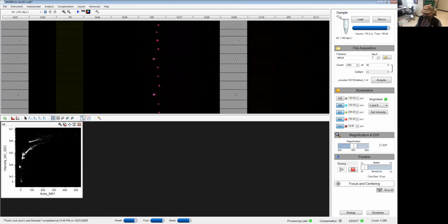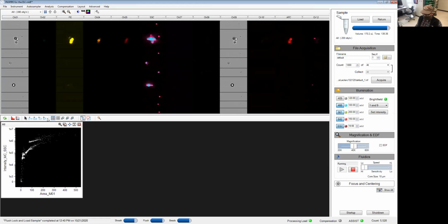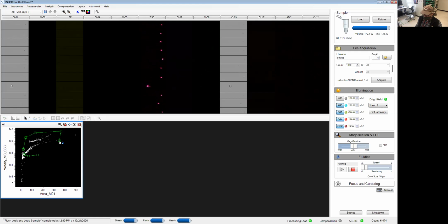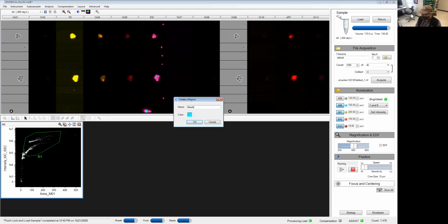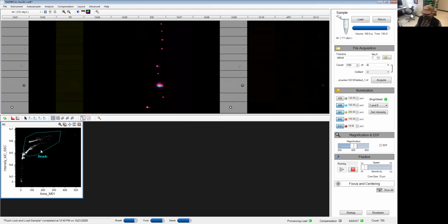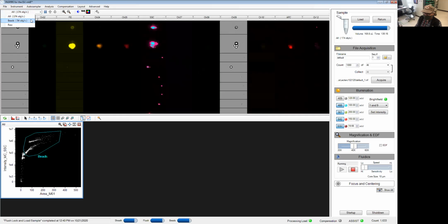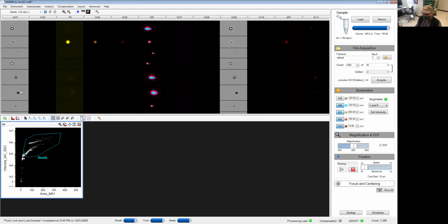So we get different things you can see here. Probably a bunch of noise at the bottom. These are my speed beads, and these are the beads I'm interested in. So what I want to do is use these tools to draw regions on the cluster of cells I'm interested in. This R1 gate I'm going to call beads. And if you don't believe me that these are the beads, you can go at the top page here, and under all, I can now select the bead region I just selected and see what these guys look like. So they're much bigger. They are actually staining with APC. And so that should tell you that these are the actual beads.